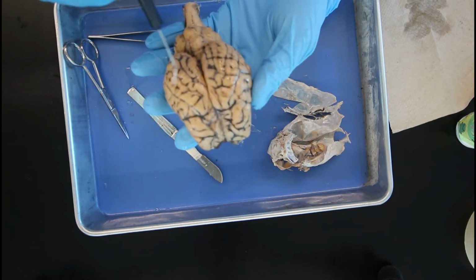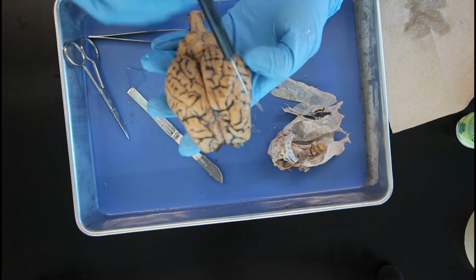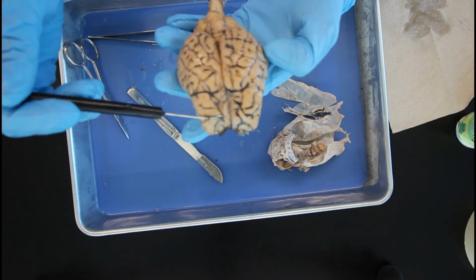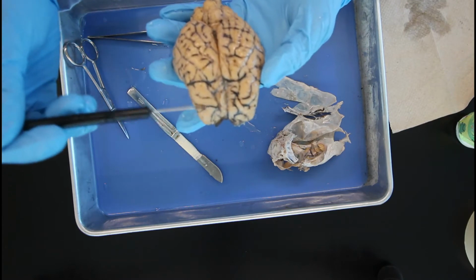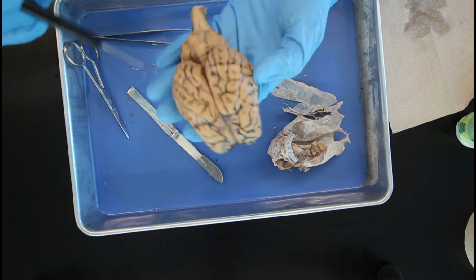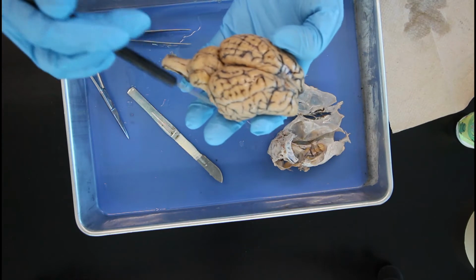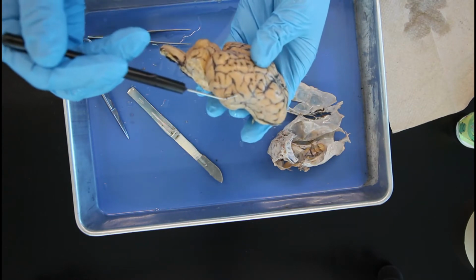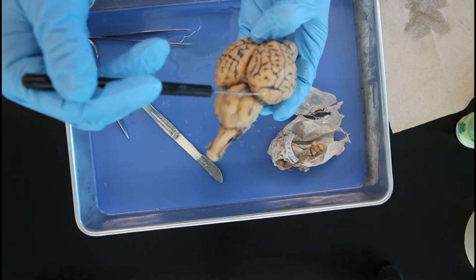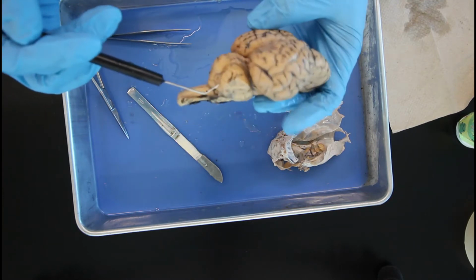So the brain is split into different regions. Right up here, this whole bigger portion is known as the cerebrum, and towards the front of the brain is where our frontal lobe is, and you can see these lines that are segmenting the different portions. Over here off to the side, we have our parietal lobe, and down below is our temporal lobe. And then more towards the back of the brain are our occipital lobes.